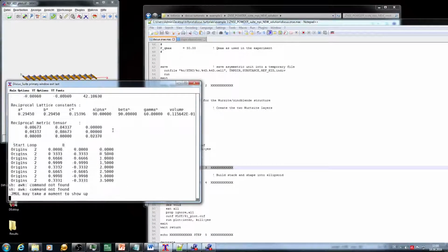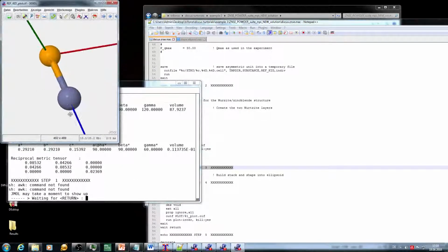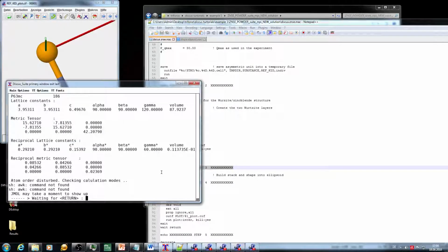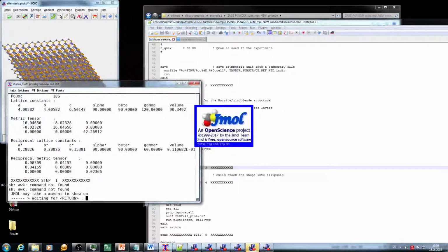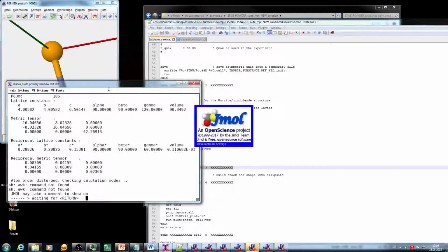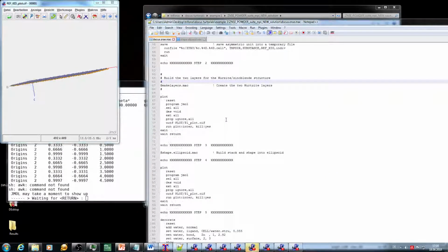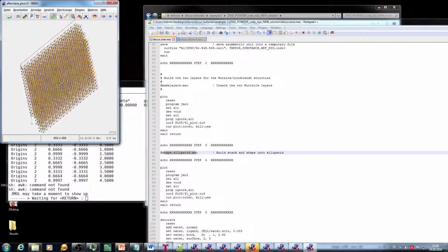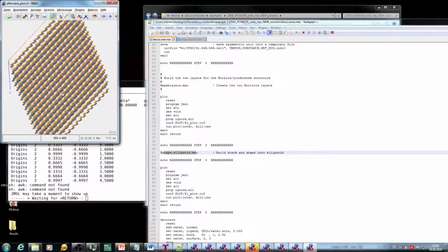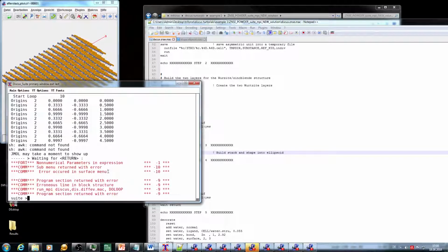So we'll go now further up to the point where the error occurs. What you see now is that we are beginning from the beginning of the loop again. So we are creating a stacked version, but we are not reaching the sphere. What should happen normally is we're creating a layer. After that, in the shape ellipsoid macro, we have a stack, and out of the stack we just cut a certain shape, some spherical or ellipsoidal shape, and then we have our nanoparticle. However, this is not happening. Instead, this error is coming up.